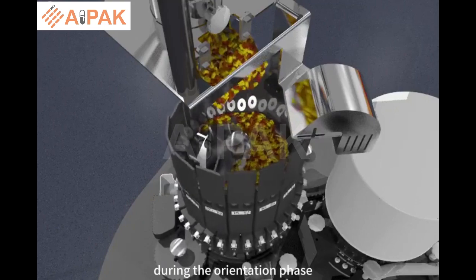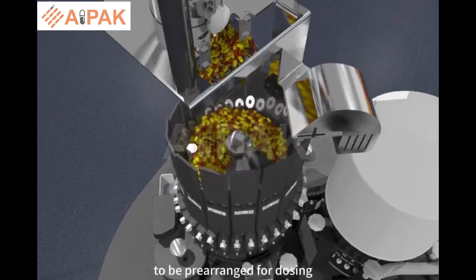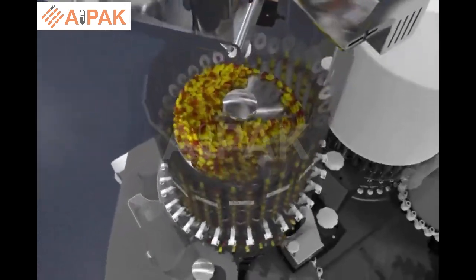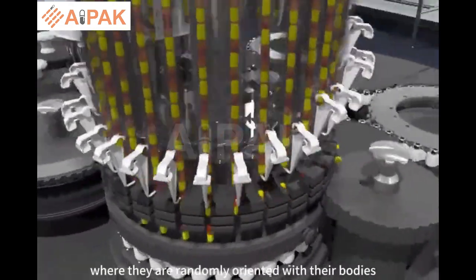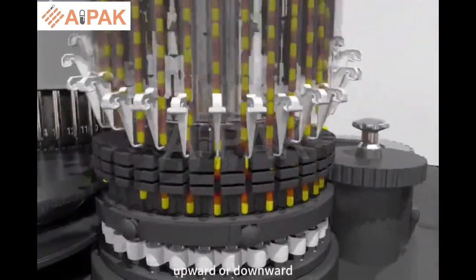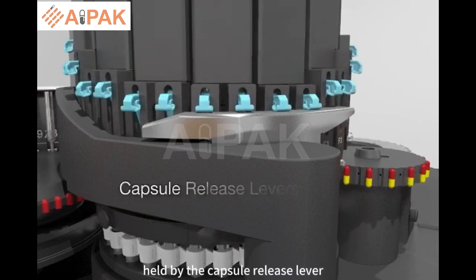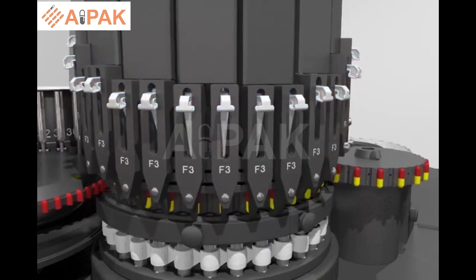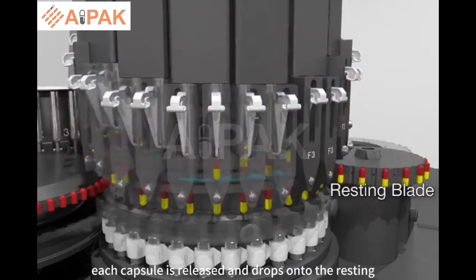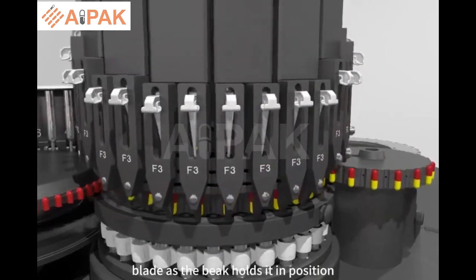During the orientation phase, capsules are oriented with their bodies downward to be prearranged for dosing. Capsules fall by gravity into the feeding tubes where they are randomly oriented with their bodies upward or downward. Held by the capsule release lever, each capsule is released and drops onto the resting blade as the beak holds it in position.